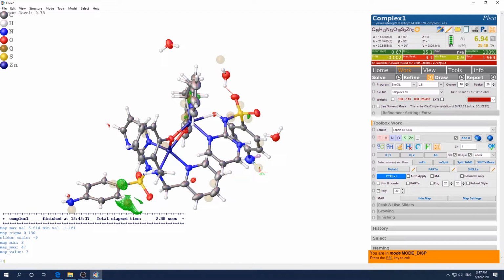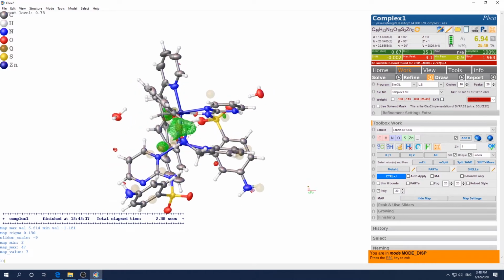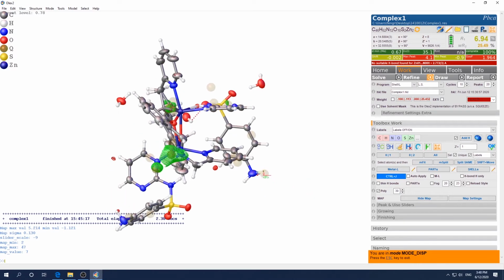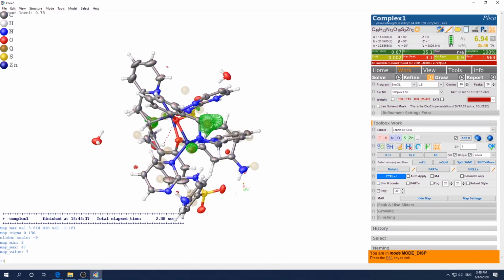Okay, when it's there, let go of the left mouse button and the shift button and rotate again. Okay, this is good. Not perfect, but it's good. It's already in that realm. It will automatically find its best, most comfortable position. Similarly, you want to do this to this proton.